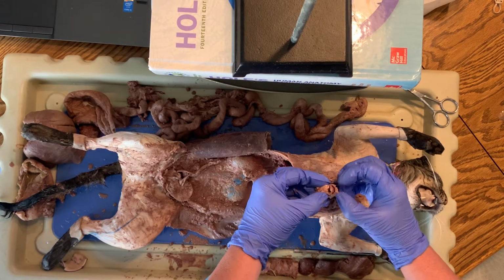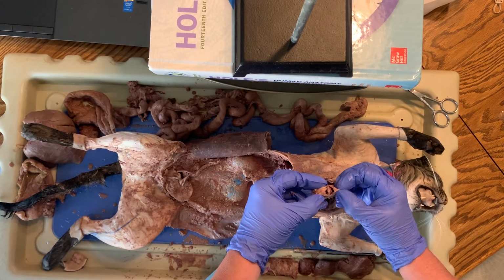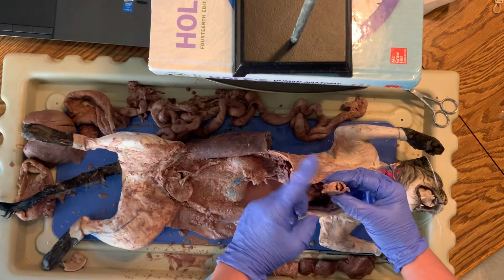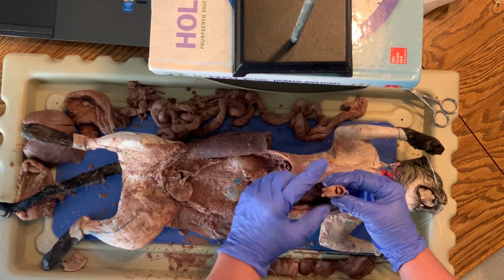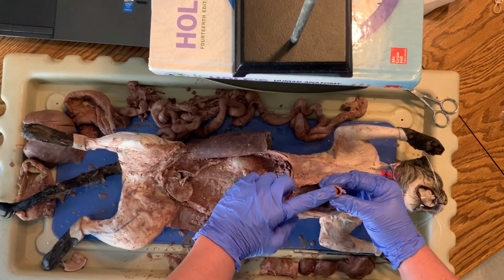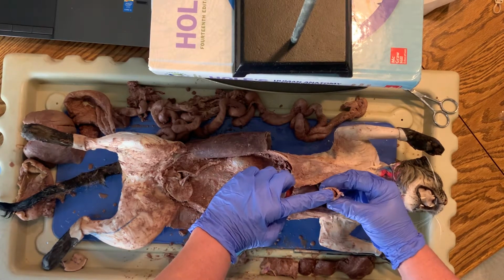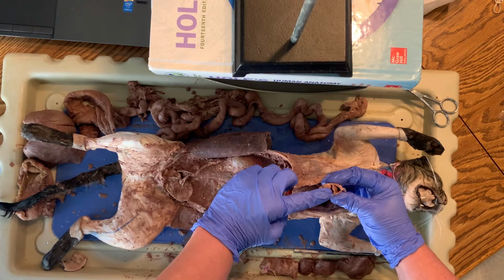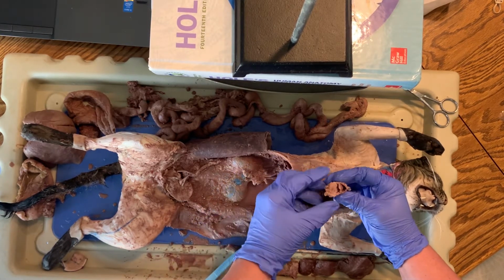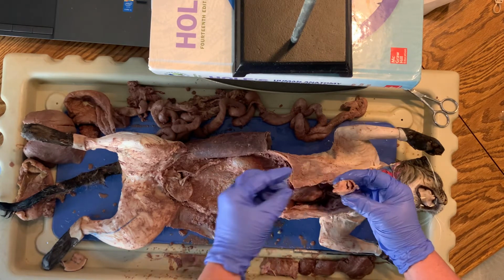So if you've ever coughed and sputtered because you swallowed something and you say, oh, it went down the wrong tube, it's because a little flap right here called the epiglottis, which I accidentally cut off, normally covers this trachea so that it only allows food to go down the back tube there, the esophagus. And if it doesn't close fast enough, then it makes you cough and sputter.